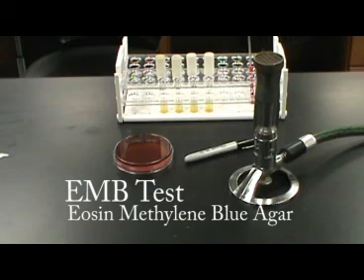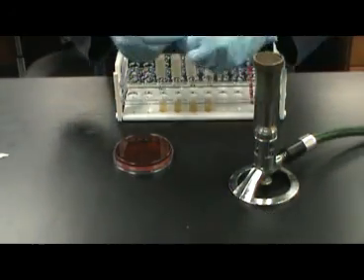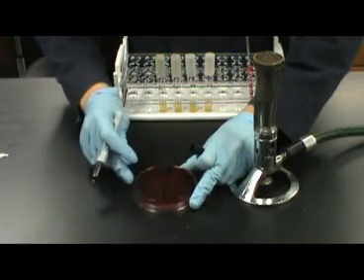The EMB test, eosin methylene blue agar. The EMB test is used as a confirmatory test for the presence of fecal coliforms in environmental samples.